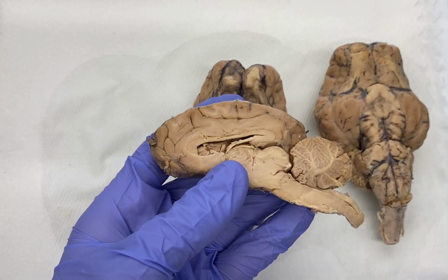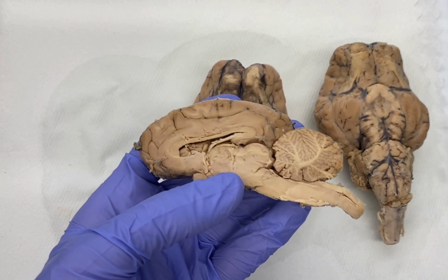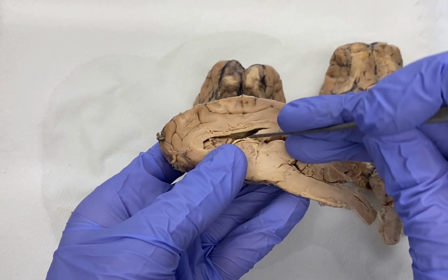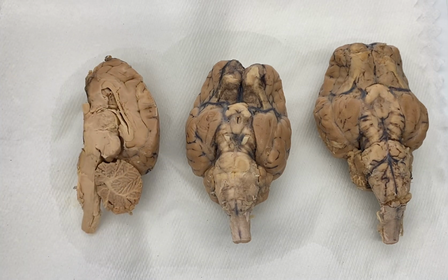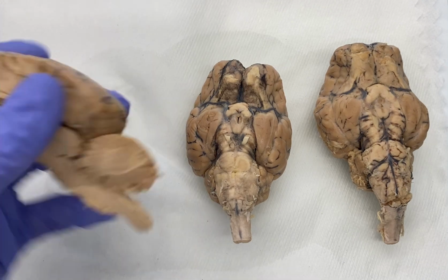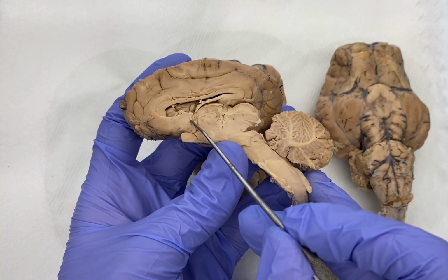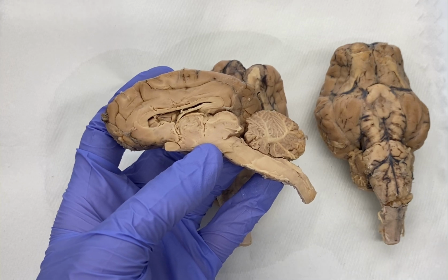It is made in these ventricles in a tissue called the choroid plexus, which is derived from the pia mater. The choroid plexus makes CSF, cerebrospinal fluid. And this CSF functions to nourish, to cushion, and to provide some buoyancy to the brain. It also helps with some exchange of ions and other materials. But from the lateral ventricles you have to go through an opening called the interventricular foramen, which is a little opening. Interventricular means between the ventricles, and foramen means a hole.